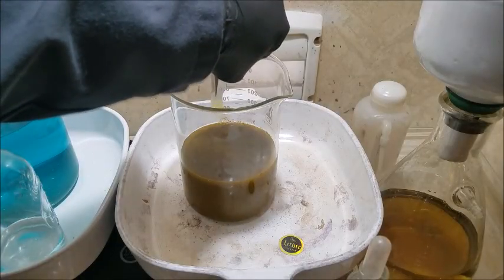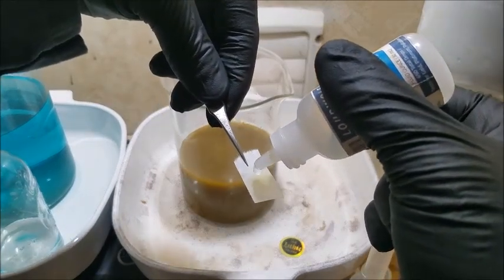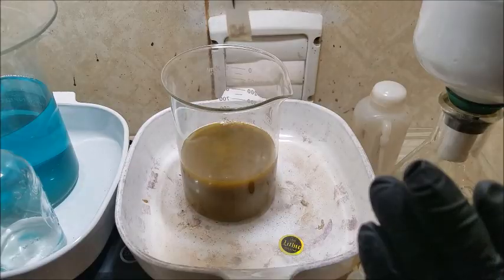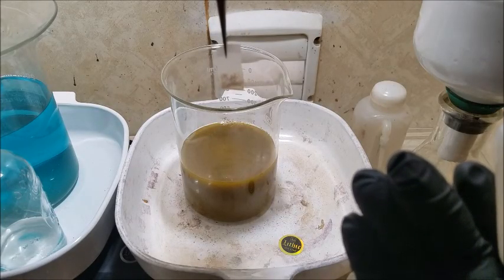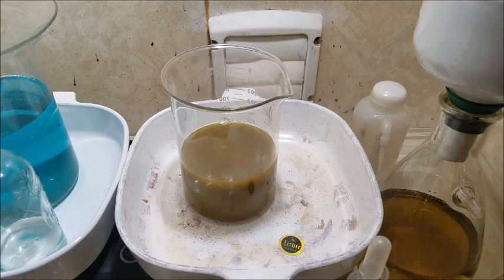Yellow, but it's a weird color. It's not gold yellow. Oh, not much. Not much of a reaction. Not much of a reaction at all. I did expect a little darker sample than that. Might not even end up with a quarter gram.